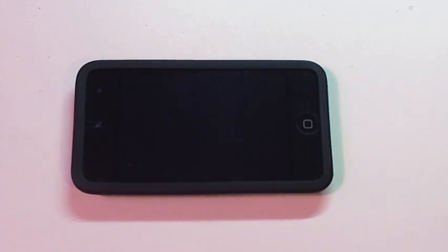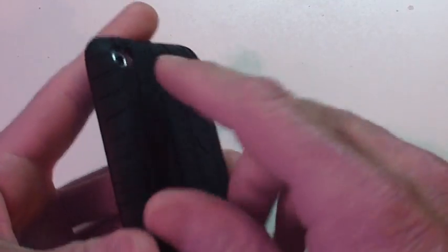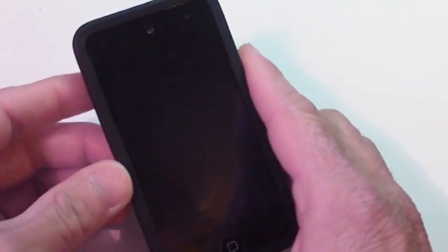Okay, finally, I'm able to make this video clip for everybody. In this video clip I'm going to show you how to turn your iPod Touch or a better iPhone 4 with an HD camera into a really powerful microscope. I say microscope, you know what I mean?